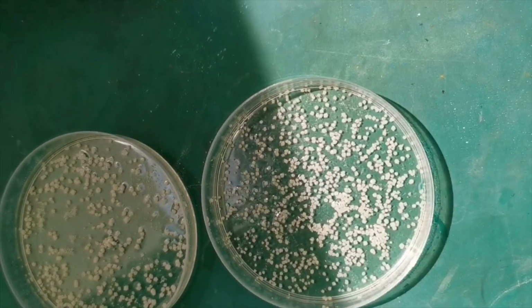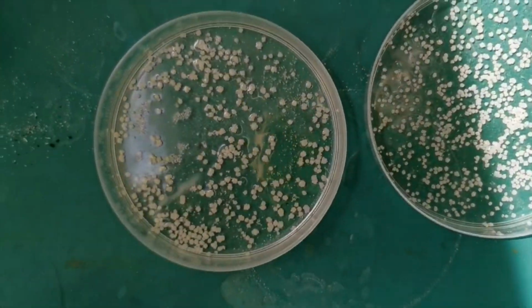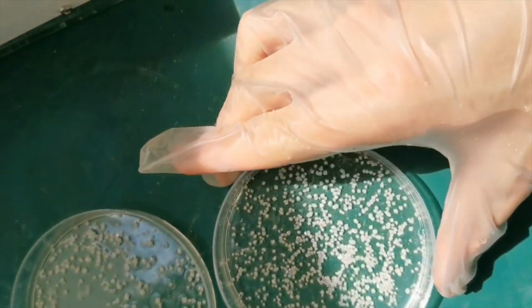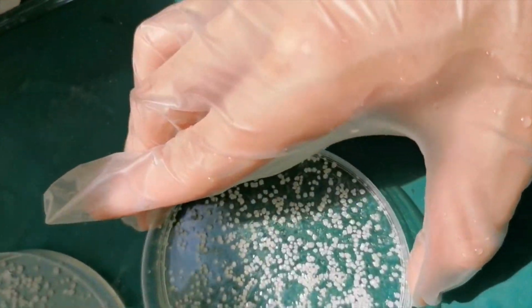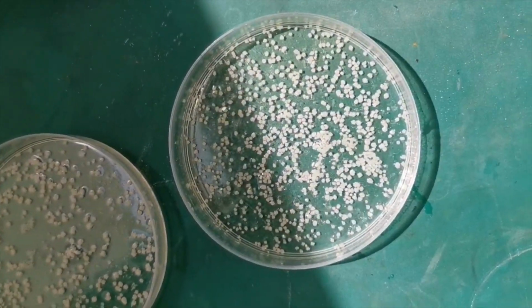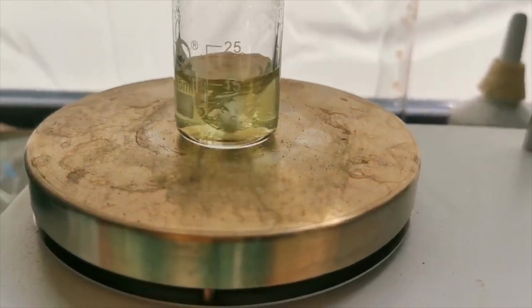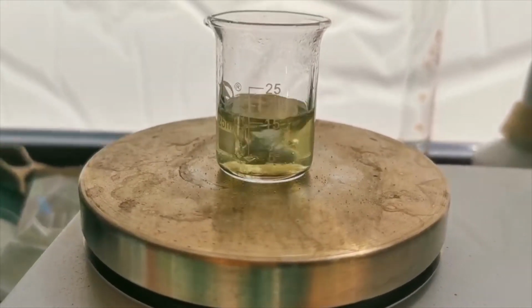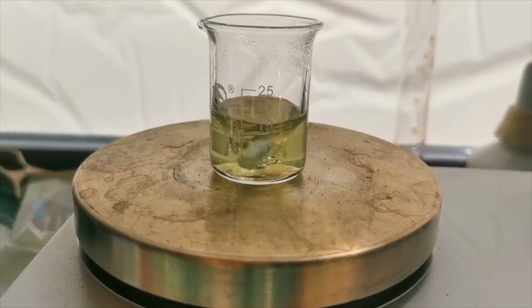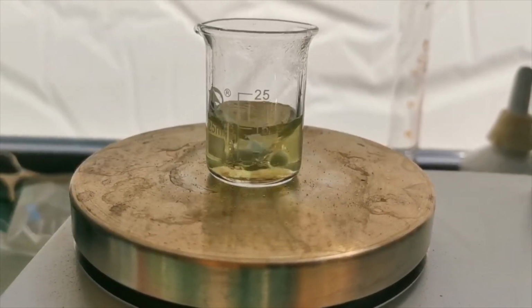After the week, a decent number of white crystals appeared in the dish. They resemble sodium chloride crystals to some degree, since they are rather cubic in shape instead of the needle-shaped crystals of other salts. I decanted the rest of the solution into a small beaker. You can see that it was slightly yellow, probably due to the remaining iodine. At least, it is quite fortunate that the impurity did not contaminate the crystals, as the crystals are perfectly white.